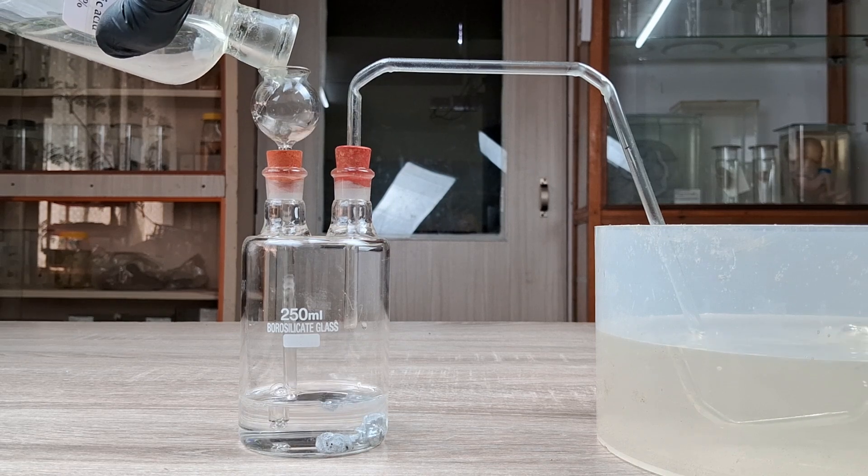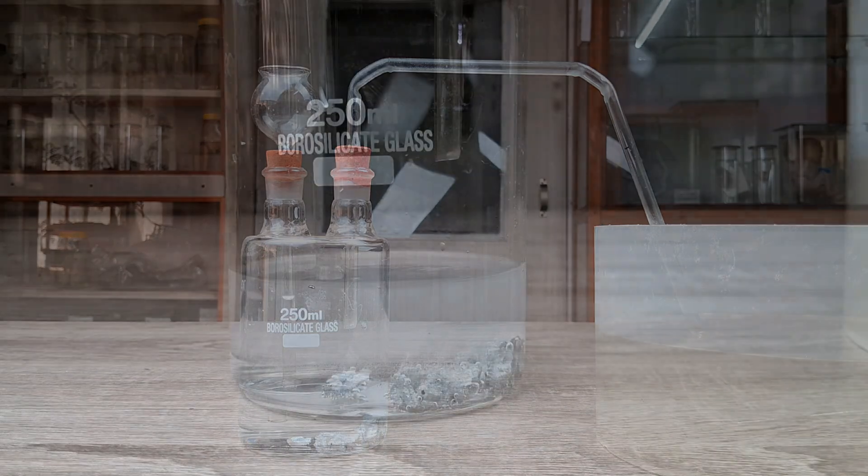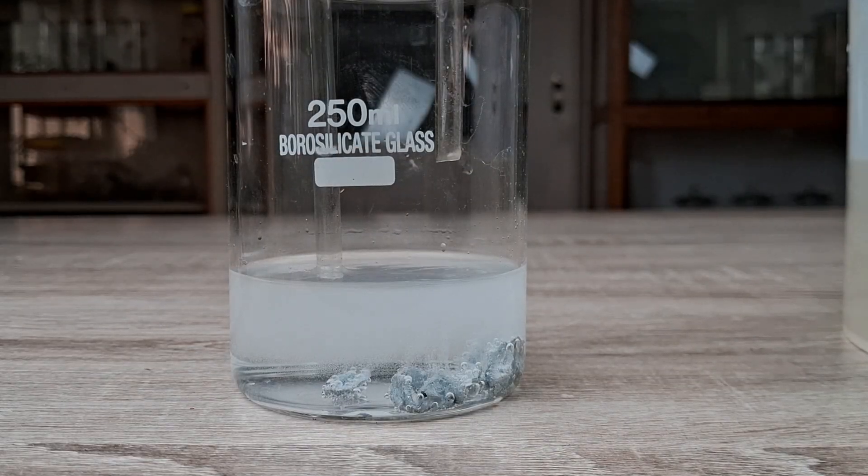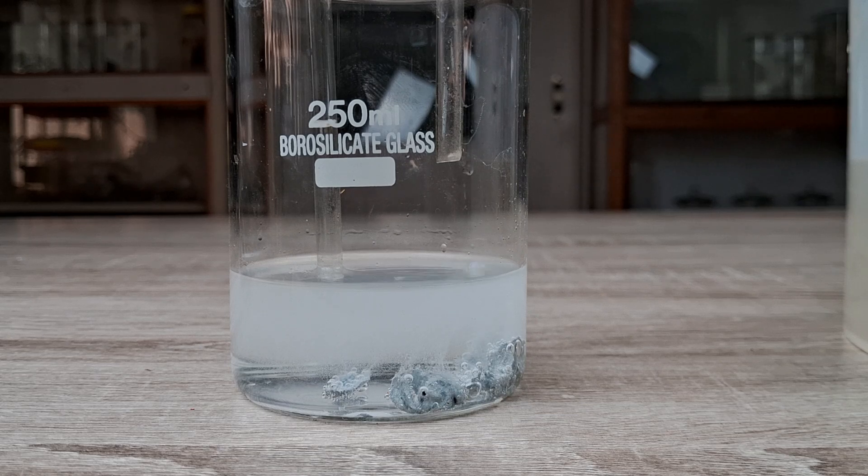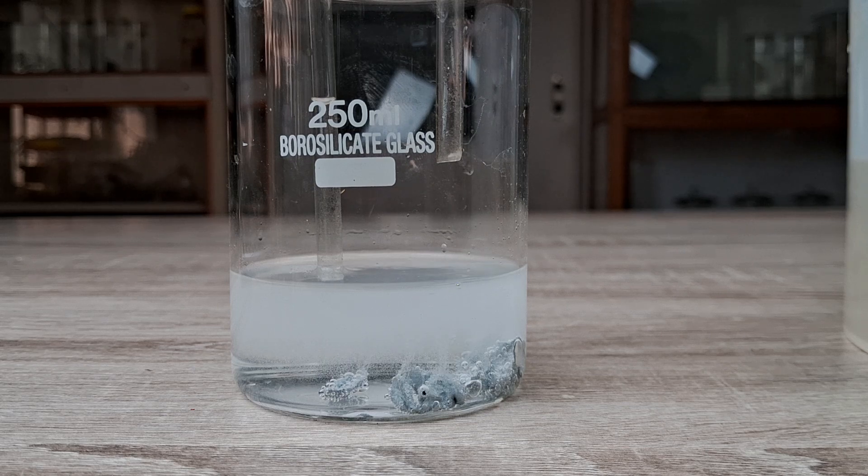Observe closely. The moment the acid comes in contact with the zinc granules, an effervescent reaction begins and bubbles of a gas are released from the surface of the zinc granules.